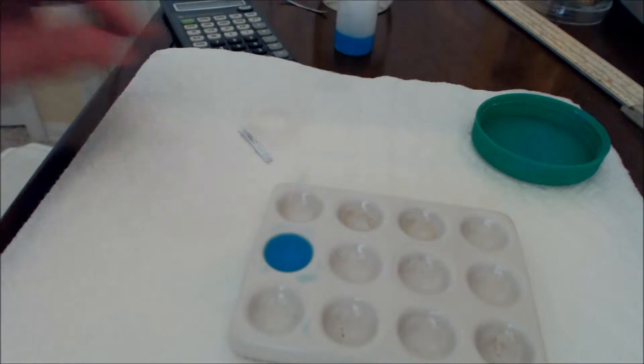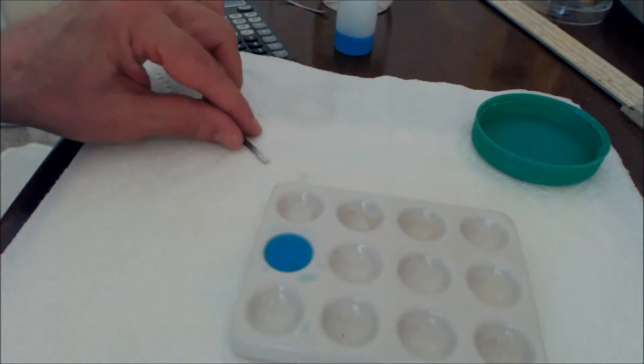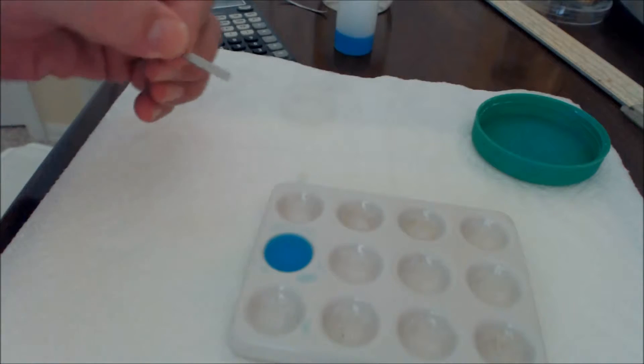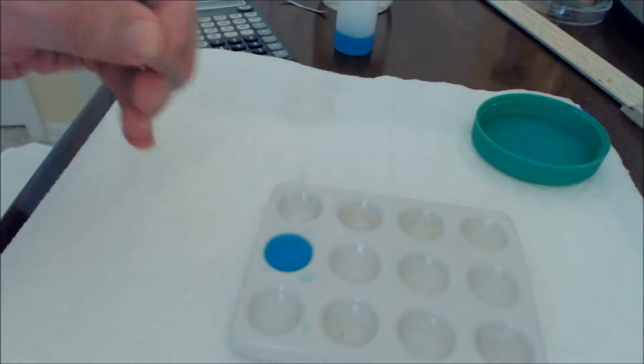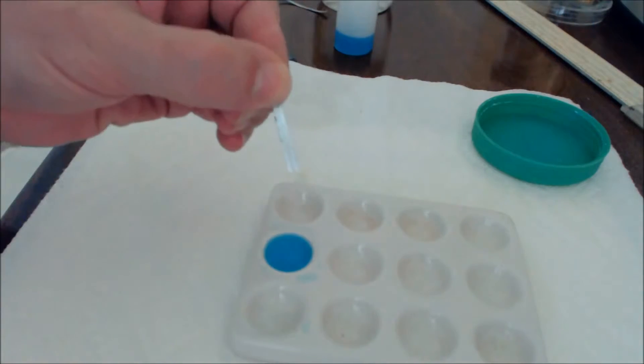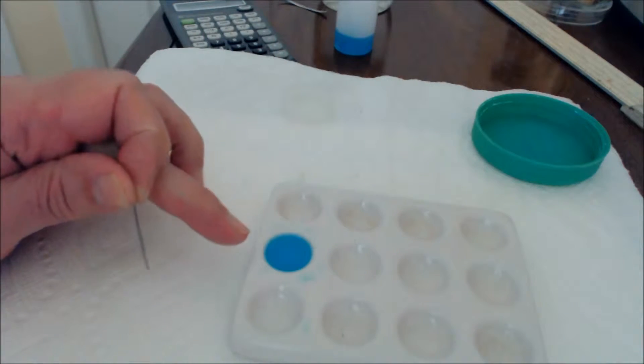Hello. I'd like to demonstrate an oxidation reduction reaction involving magnesium ribbon, magnesium metal, Mg solid, and copper sulfate.